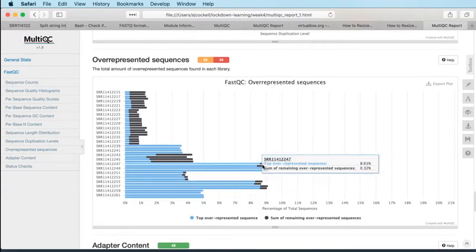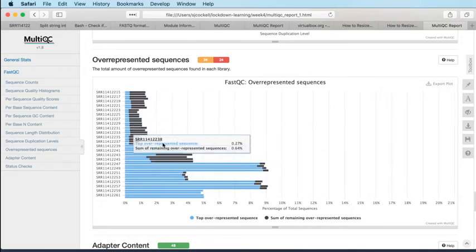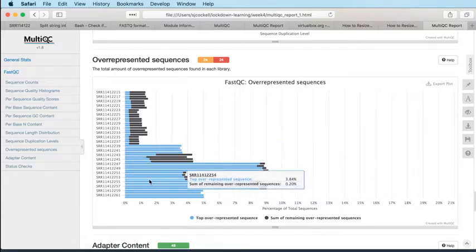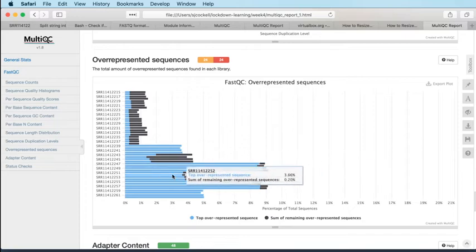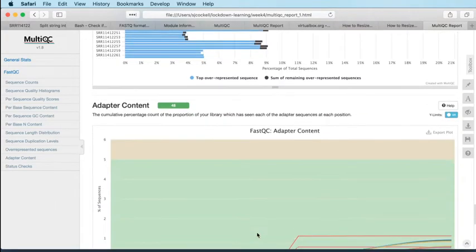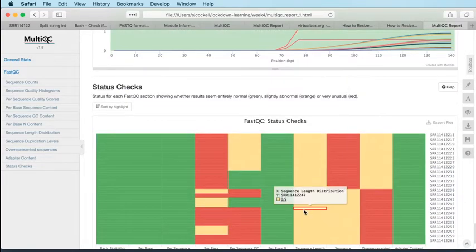And then overrepresented sequences. So, okay, I would say if we are looking at viral reads at all, we're looking at them in the second set, because we've got a lot more overrepresented sequences in the second set than we have in the first. And I would put good money on that being the virus, to be honest. So I think that's where we're seeing that being exhibited. And then adapter content is fine. There's a little bit, but again, it never really gets above 1%. So let's not worry too much about that.